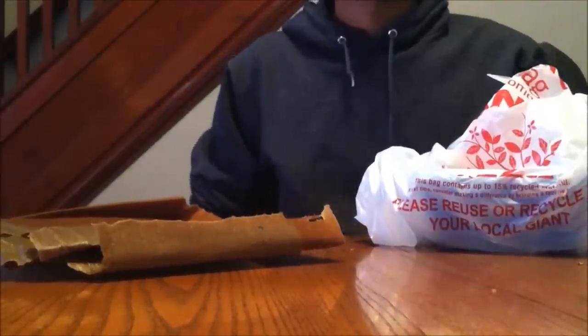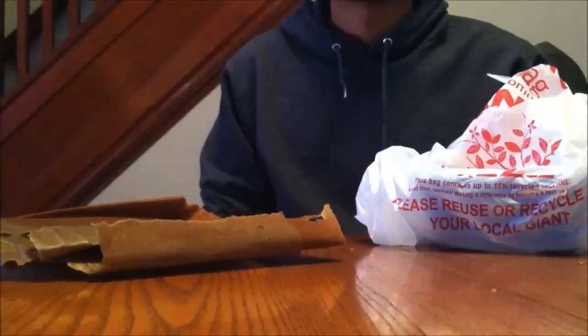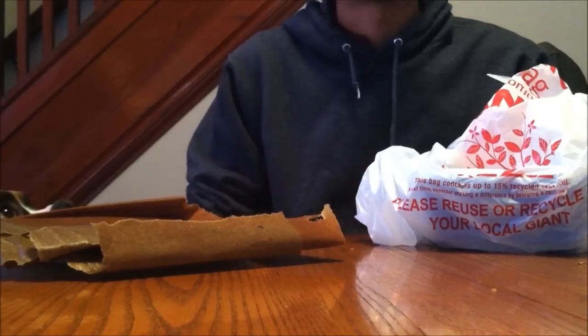Hey everybody, it's Will. Today we are going to be cloning Pleurotus ostreatus. This is the common gray oyster mushroom.